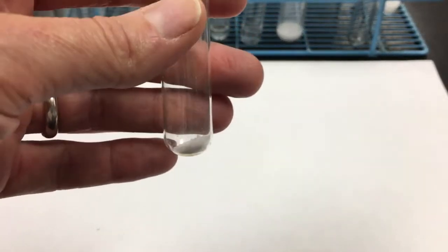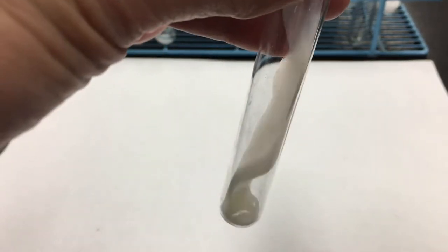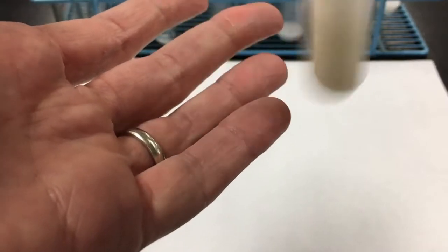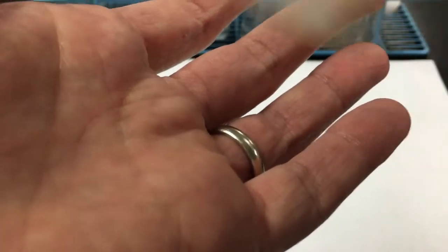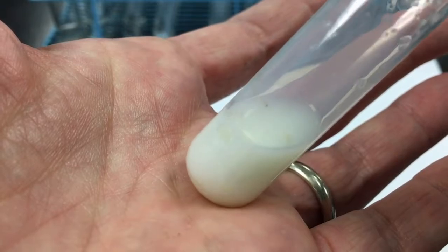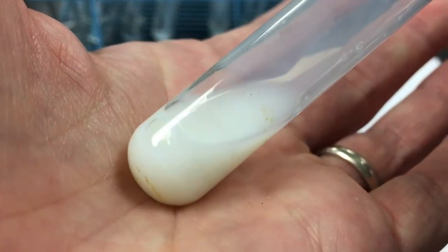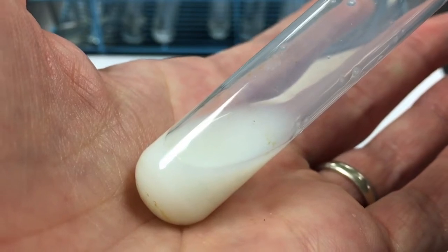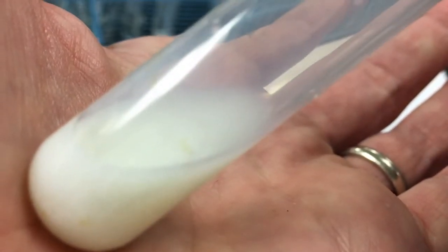Experiment 8. This time I'm going to use liquid 3, and this is with solid C. Remember, liquid 3 is white and cloudy, and the cloudiness makes it a little hard for me to see whether solid C is still there or whether it's disappeared. A little hard to tell. I don't feel anything, any changes, or I don't see or hear any bubbles.